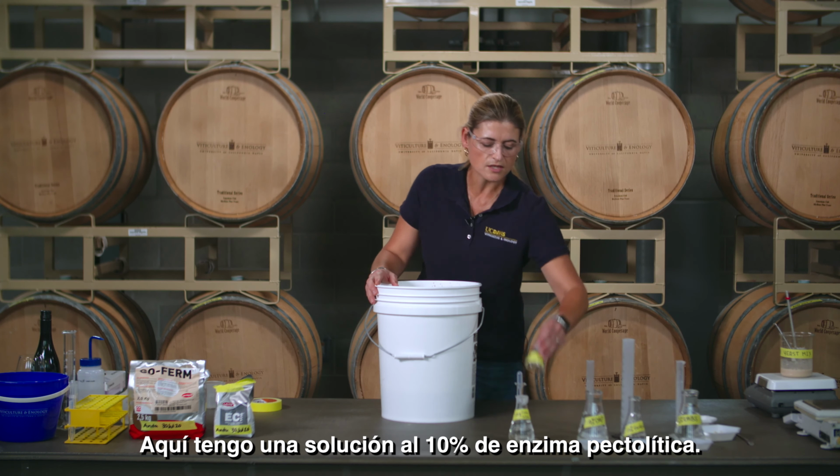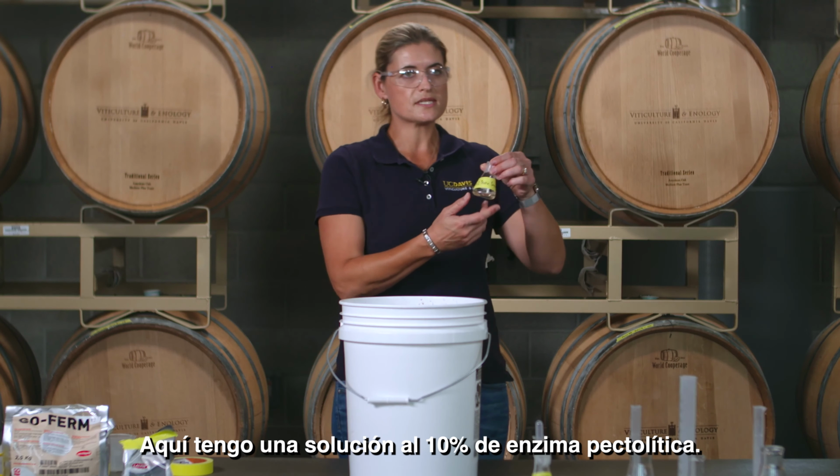I have a solution here of 10% pectolytic enzyme. I'm going to add it at a 40 milligram per liter concentration to my must. And that is really only about 1.3 milliliters. So I'm going to use one of these plastic pipettes to do that.